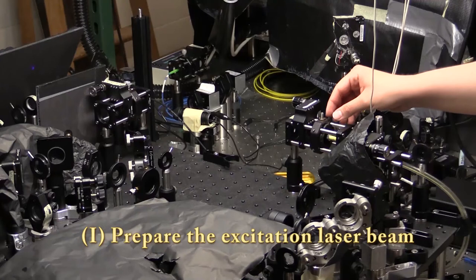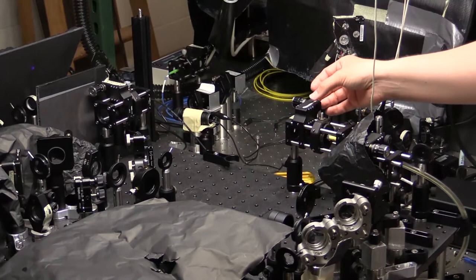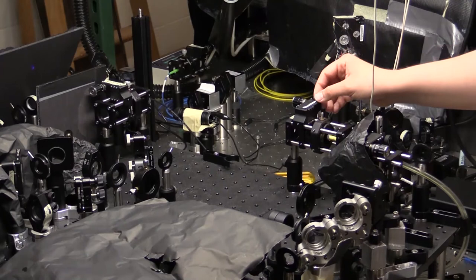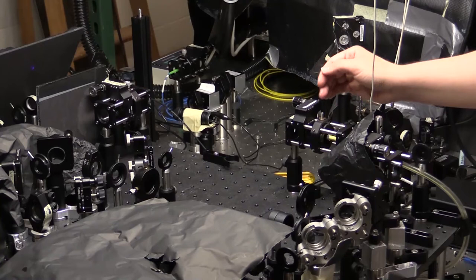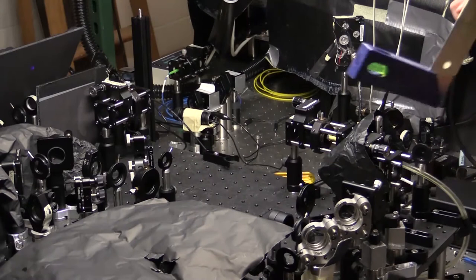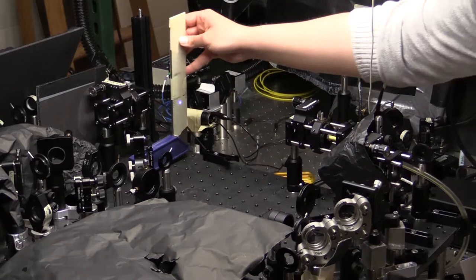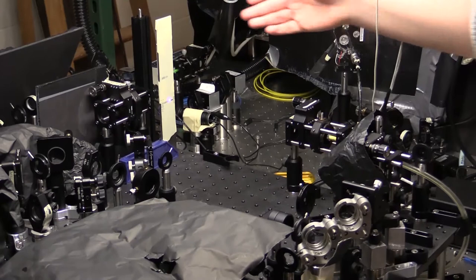The first step in aligning a confocal microscope is to collimate your laser beam. Oftentimes, if it's coming out of a fiber, it'll be expanding, so we need an aspherical lens to collimate the beam. See the references below for a tutorial on how to choose a collimating lens. Once you've chosen your lens and placed it about a focal length away from your laser beam, you will then have to carefully center the beam and have it exactly one focal length away from the entrance of your fiber. To do this, we can use either a handy card or a right angle ruler with some white tape on it so we can see our beam. You know a beam is collimated when you look at the beam close to the laser and far away it is the same diameter.